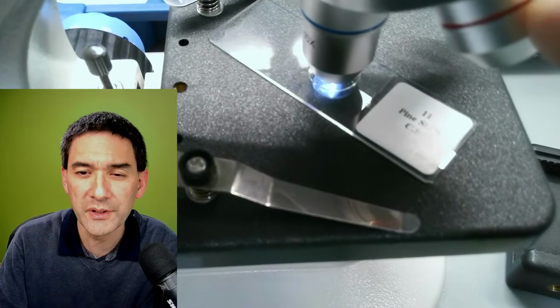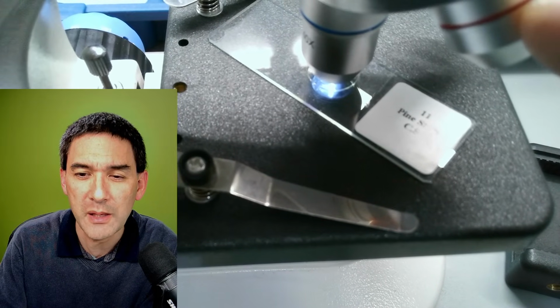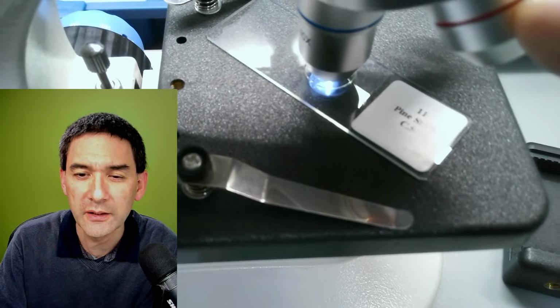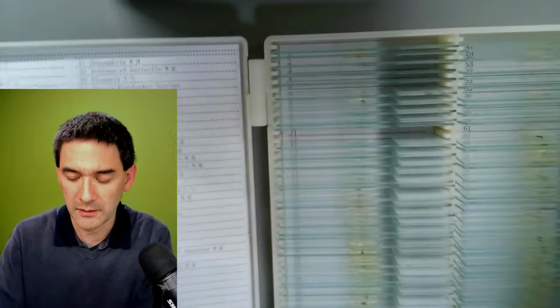You could put some different smartphone screens under the microscope in the next live stream, maybe under the stereo microscope, and look at the different pixels. Oh yeah, that's a possibility. Smartphone screens have different pixels.